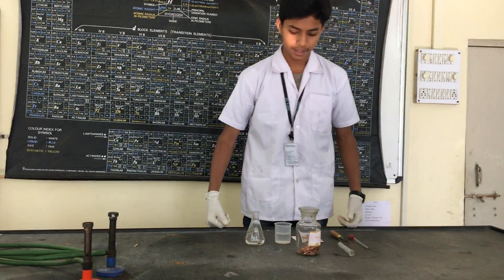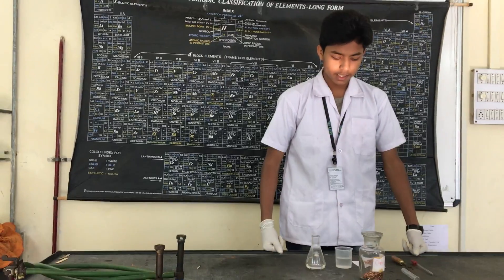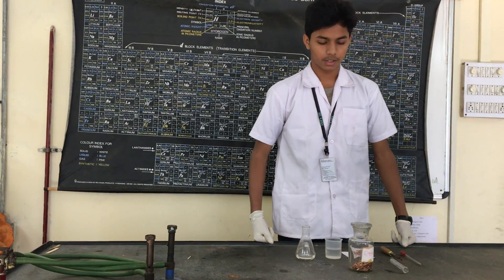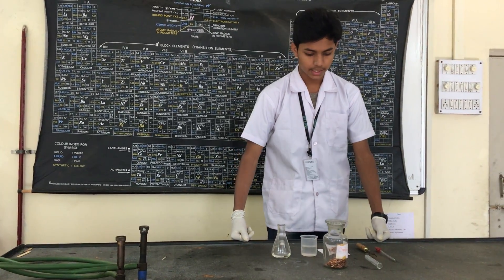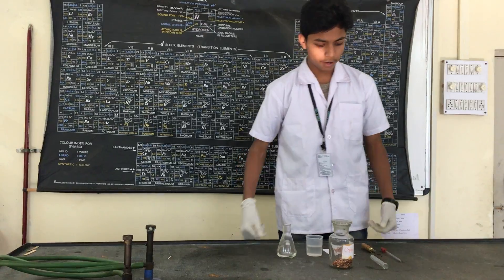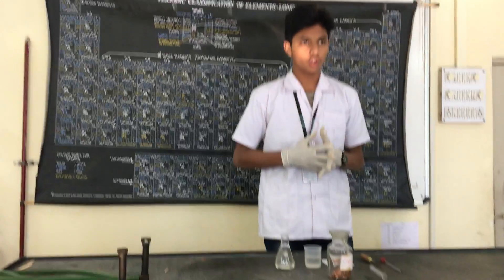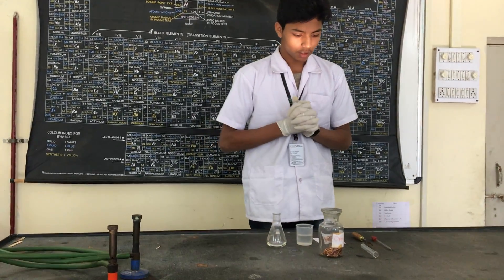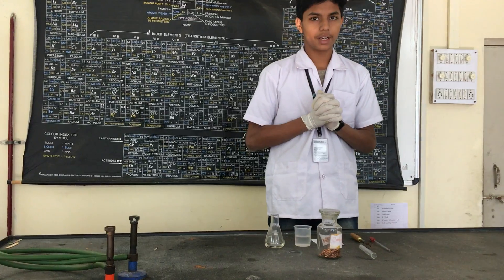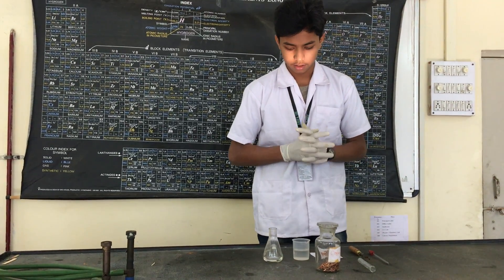Today we are going to perform an experiment with nitric acid and copper. As we know, we have used concentrated nitric acid, so we have to take care that all apparatus used is dry and clean.